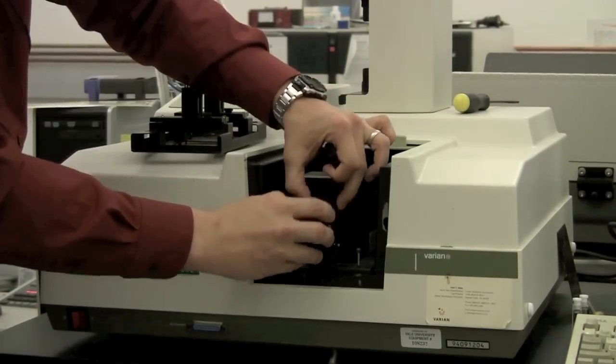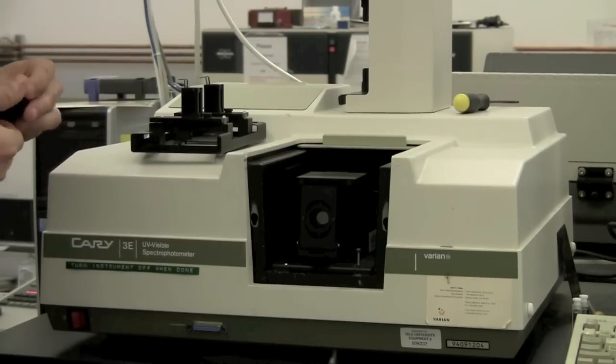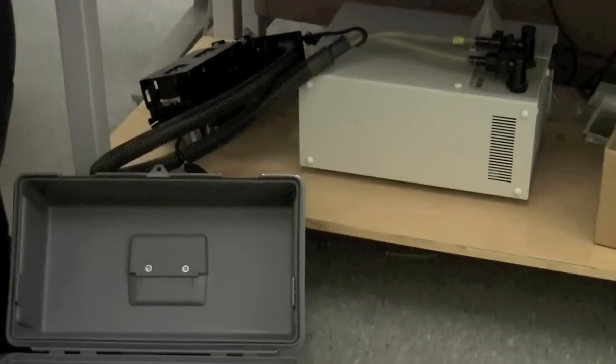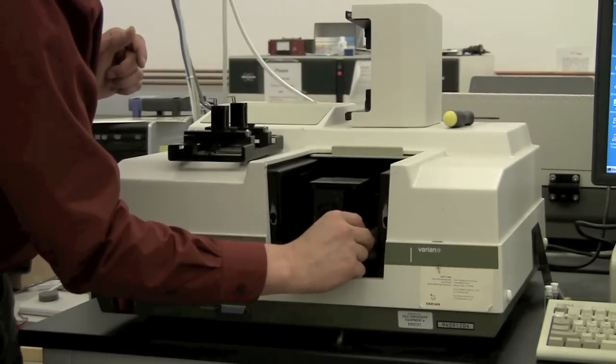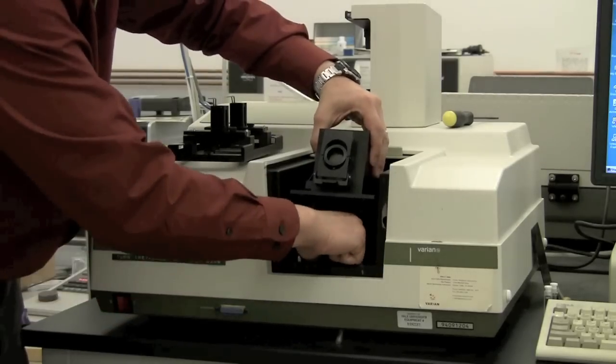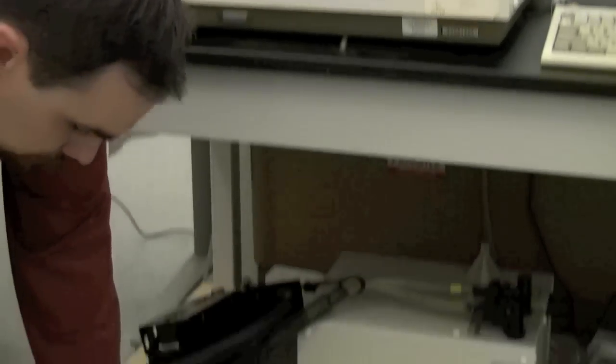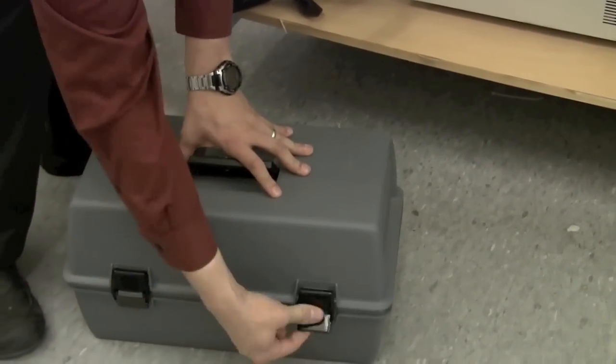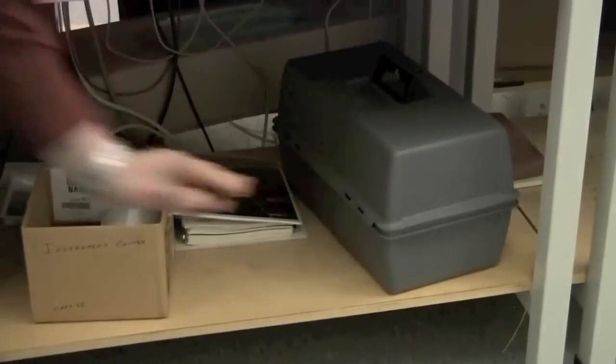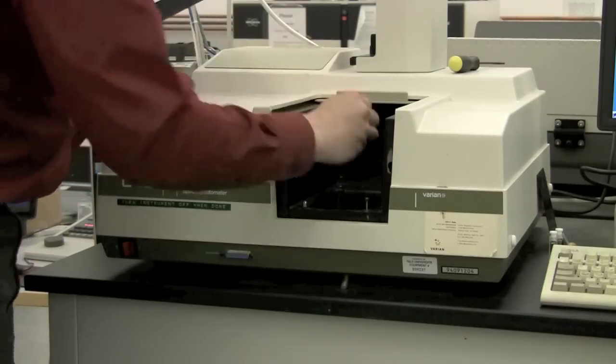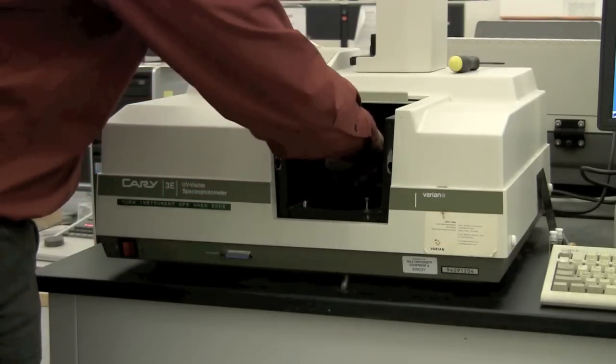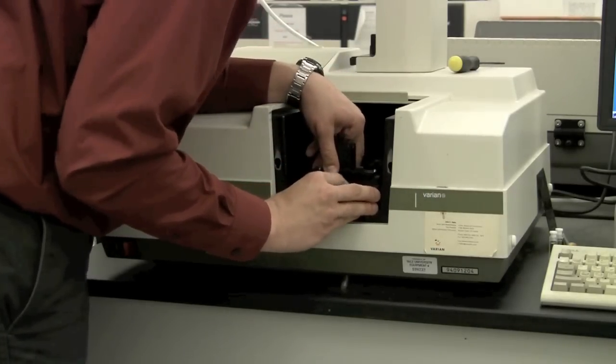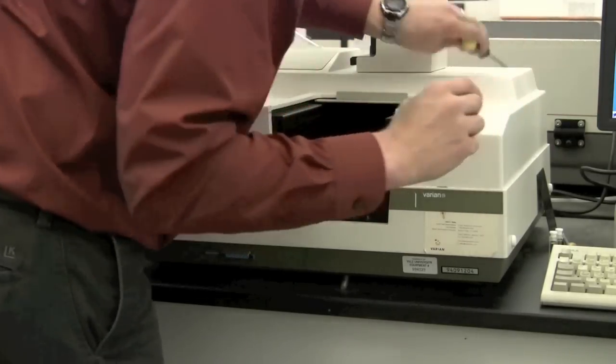So I'm going to take out the puck, and I'm going to take out the integrating sphere, and put back the standard cuvette holder. This goes over here under the instrument. Okay, so we put back the standard cuvette holder. It's probably easiest to get the hex screws started a little bit. And then you can slide it in place, and then tighten it down.